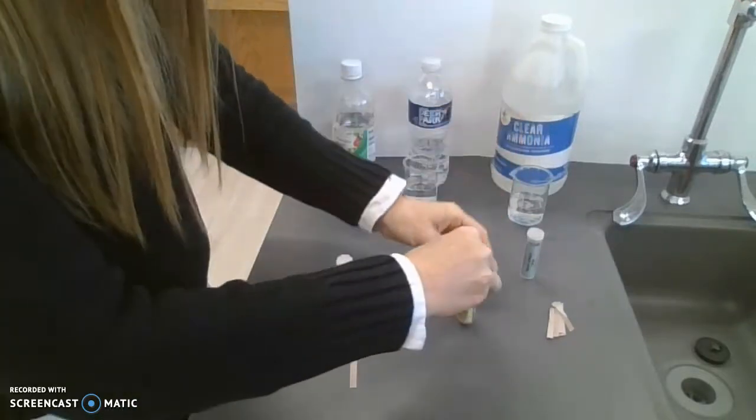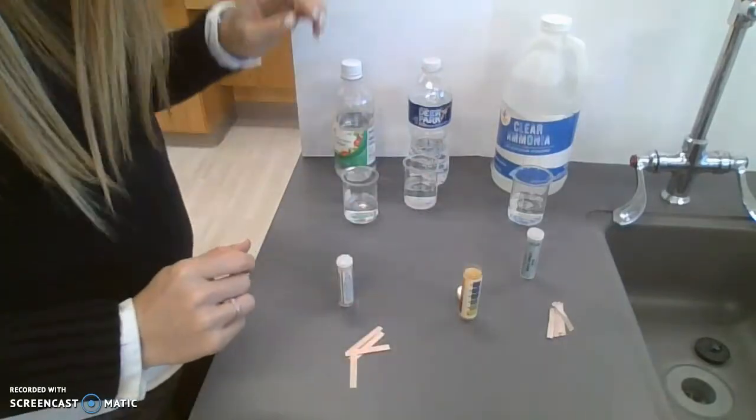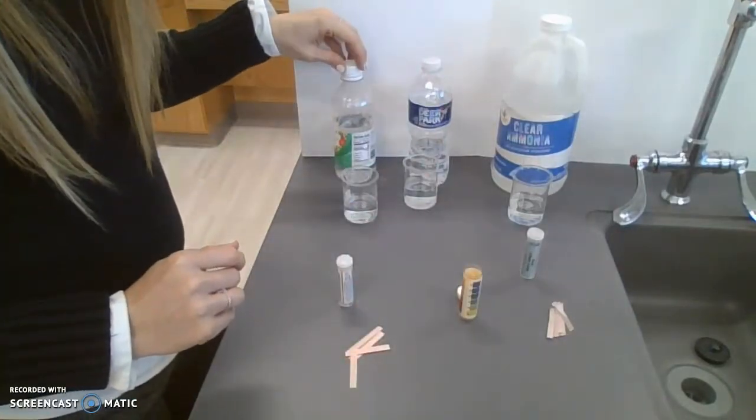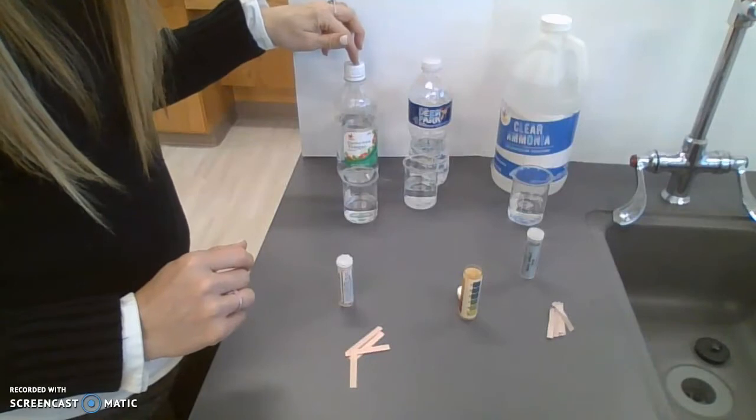So we're doing a quick test here with vinegar, which is acetic acid, Deer Park water, and some ammonia. I poured some into my beakers here.